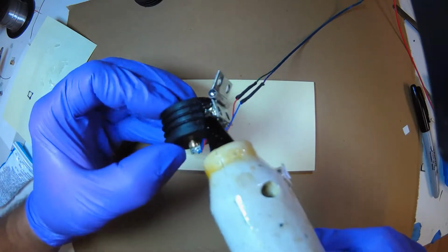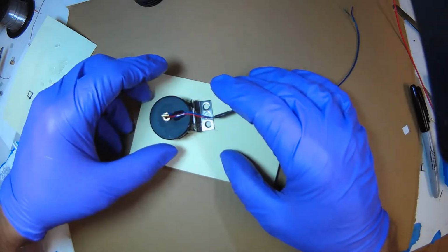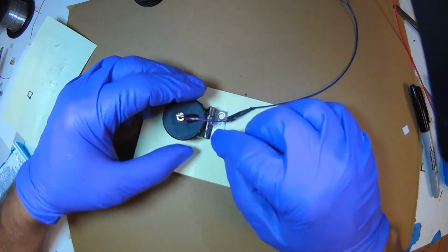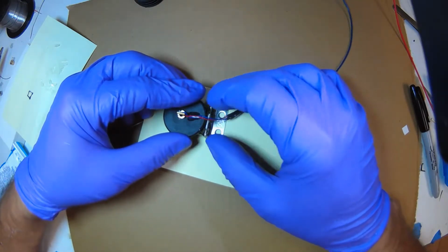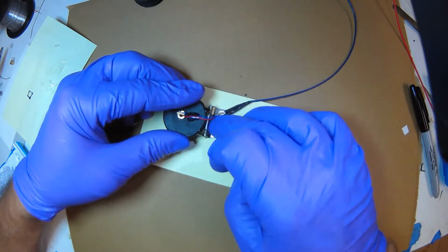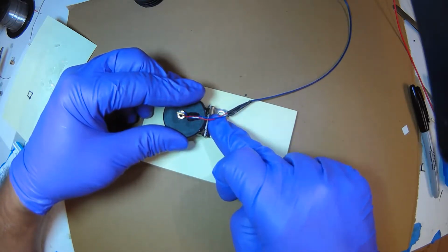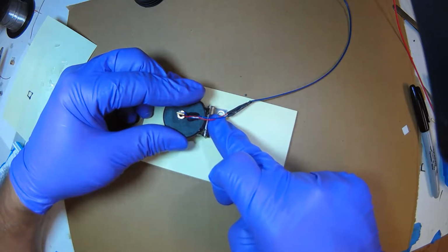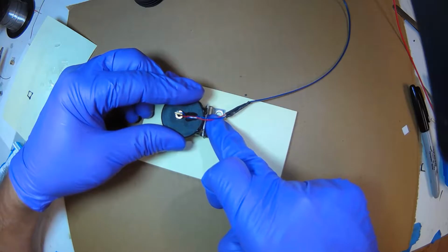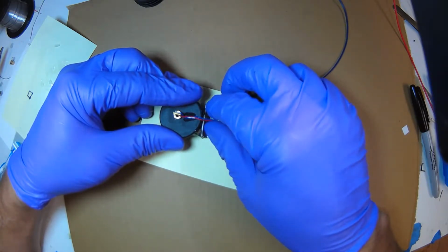I can feel the hot glue is actually melting the tacking one. So I'm going to put it back down and get it oriented. I'm pushing on the hinge to make sure it's flush, because when I put the extra hot glue, it melted what I tacked. Now I'm pushing pretty hard down, and I'm also pushing the top half of the hinge into the cylinder, so everything is at right angles.